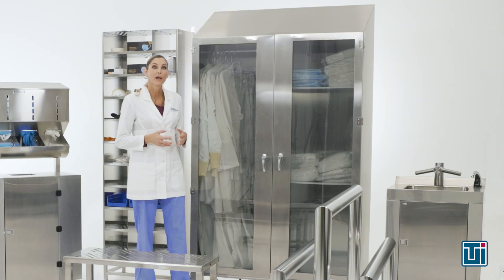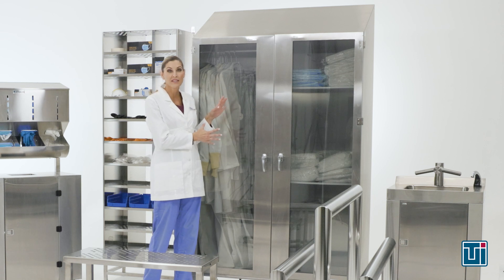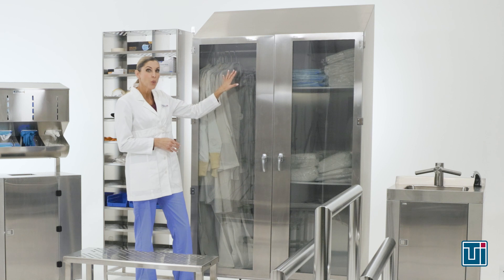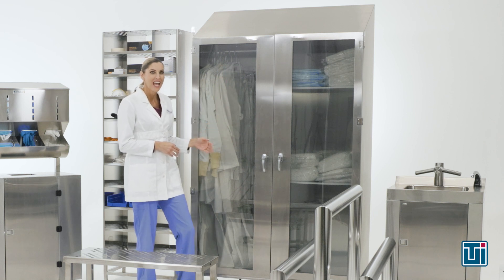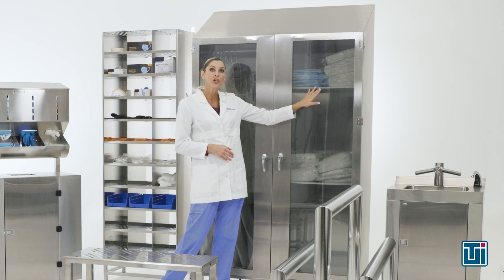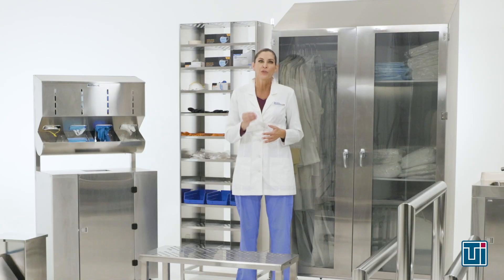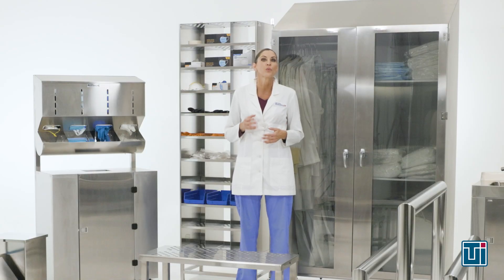All reusable garments are kept hanging inside Terra's garment and supplies cabinet. This setup includes one chamber with a hanging rod for frocks and coveralls, and a second with shelves for hoods, masks, and other supplies. Terra also offers models with a fan filtration system that uses a continuous stream of HEPA-filtered air to wash particles from stored garments.